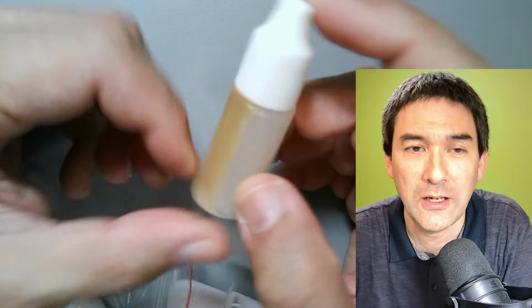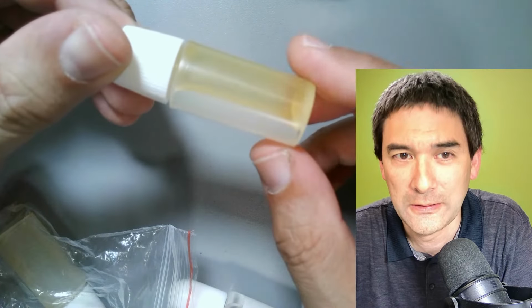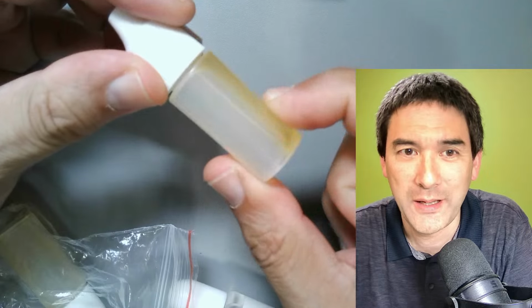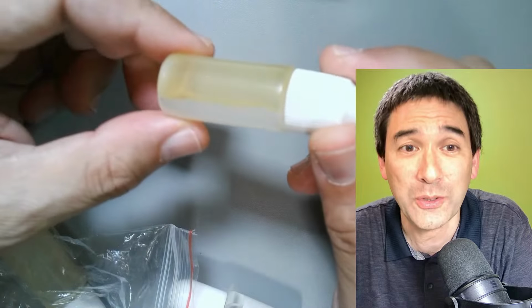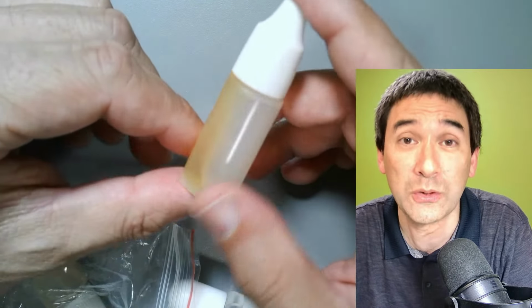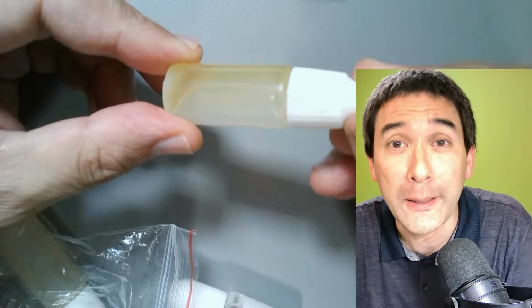Look, how do you like this bottle of immersion oil? Do you see this yellow liquid in here? Look, it has completely turned solid, and is totally not usable anymore. It's like honey. So this is actually one of the problems with oil immersion microscopy, that some immersion oils, the so-called natural immersion oils, sometimes tend to solidify over time.